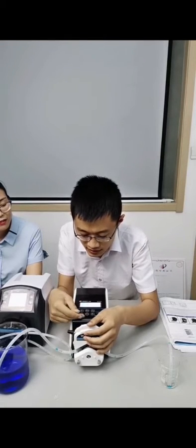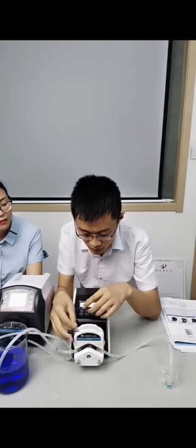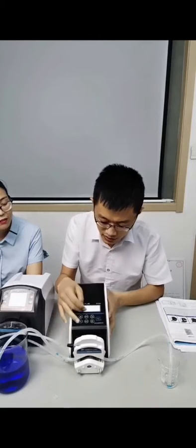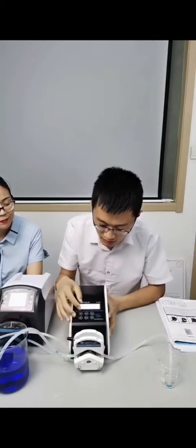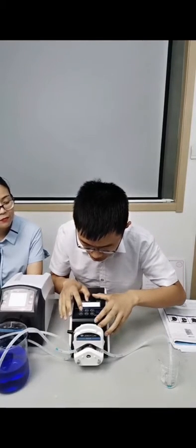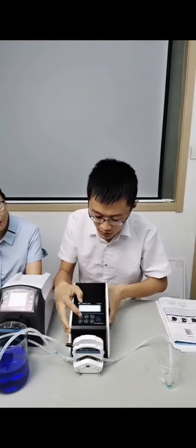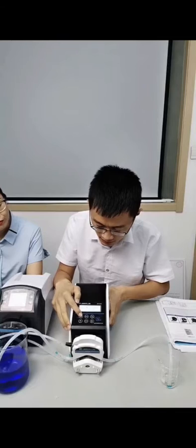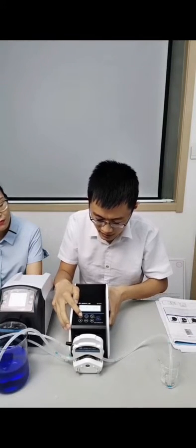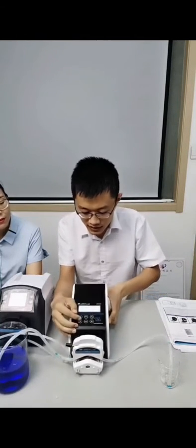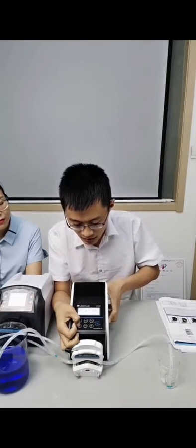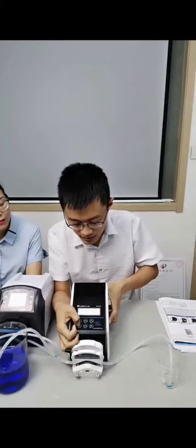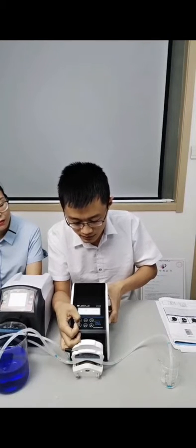The down key is used when you want to reduce RPM on the LCD display. As I said, the max RPM is 100. I can show you. The down key is to reduce. Long press the key, you can see the value is reduced.